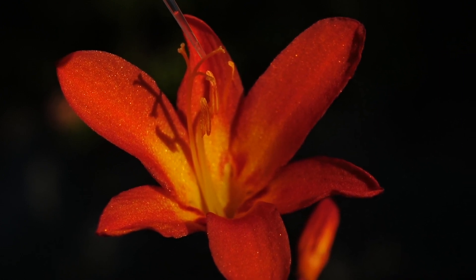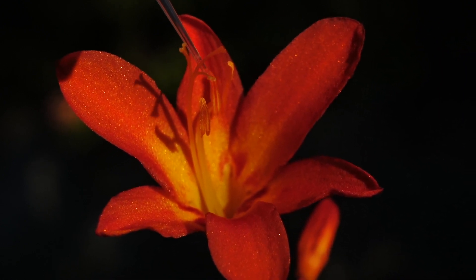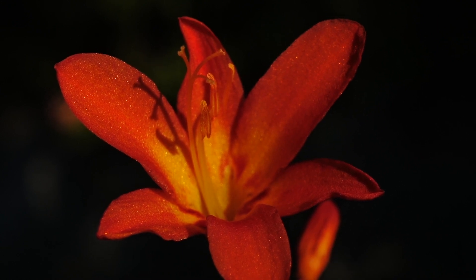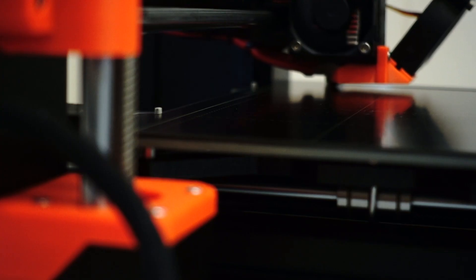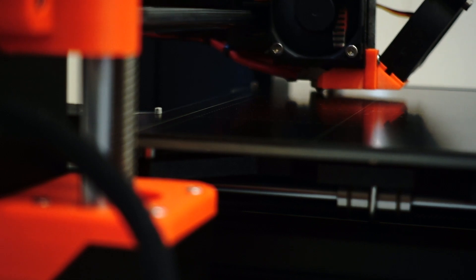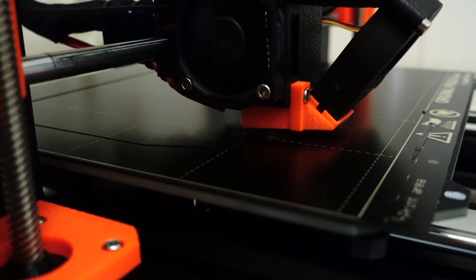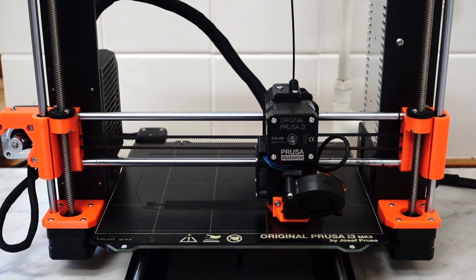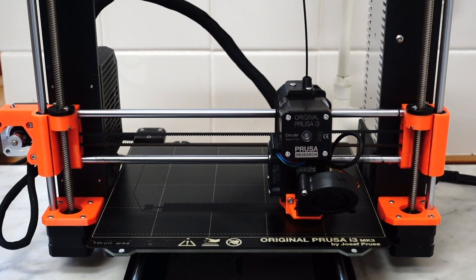I started thinking that perhaps we could attach quantum dots to pollen grains. When I finally got the quantum dot method to work, I realized I needed a fluorescence dissection microscope, so I decided to try and design a fluorescence box that you could fit under a dissection microscope like this.